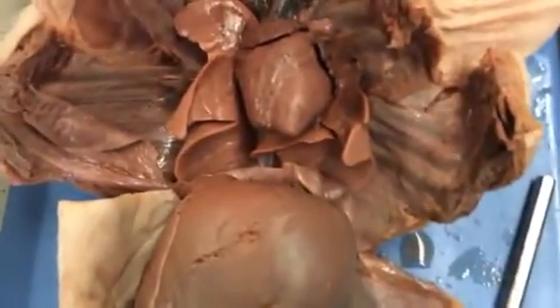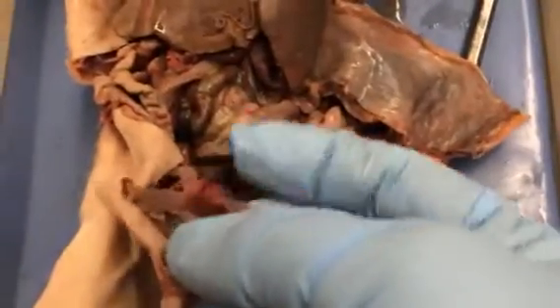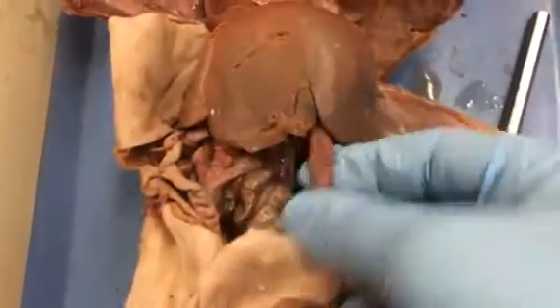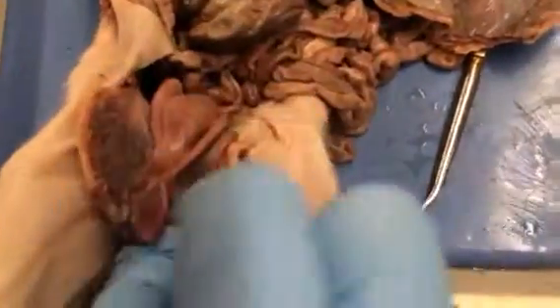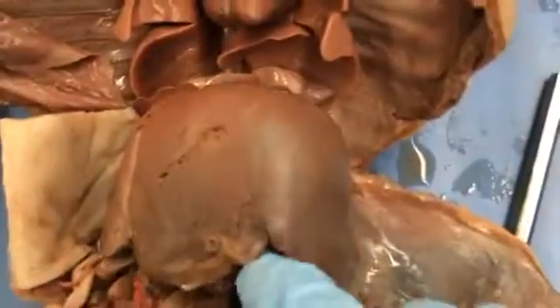Before that, the blood comes in through the structure here called the umbilical vein. Oxygenated blood enters the fetus through the umbilical vein. It would be connected here, and blood exits the fetus through these two structures here called umbilical arteries on either side. It comes in through the umbilical vein and actually bypasses the liver because it's already cleansed.